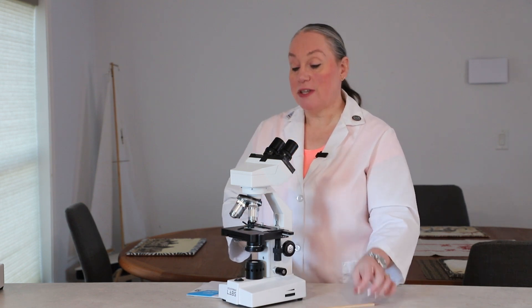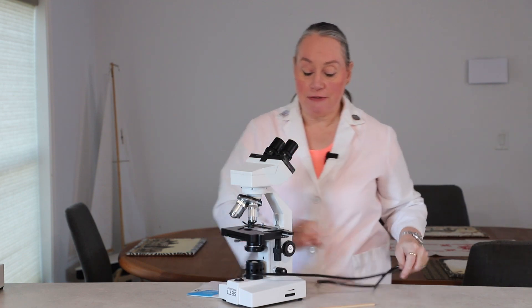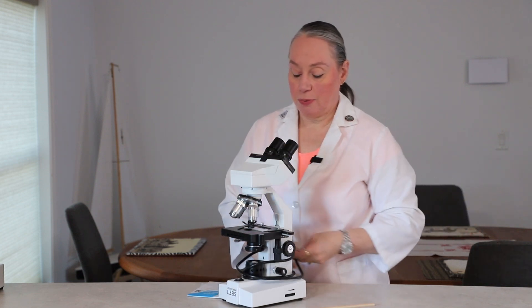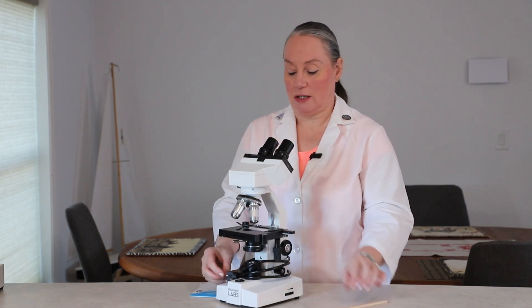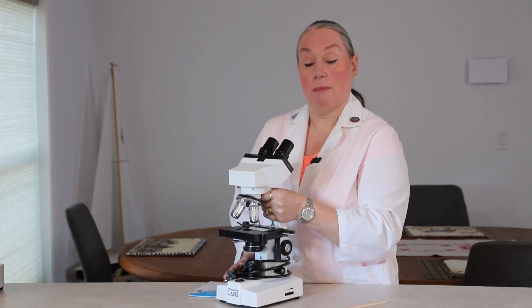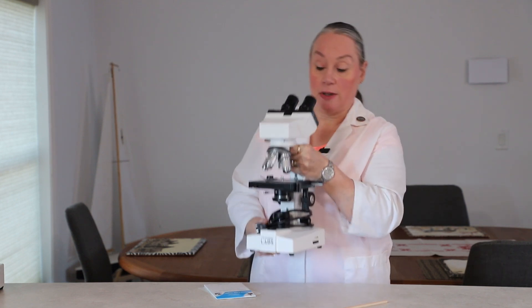Let's talk about how to handle the microscope. This information can be found in your safety manual, in your binder. Most often you may come into class and the microscope is sitting on a shelf, with its cord hopefully nicely wrapped up. You want to make sure that's out of the way when you pick it up. When you pick up a microscope, you are going to pick it up by the arm with a hand under the base — it's always two hands on the microscope.